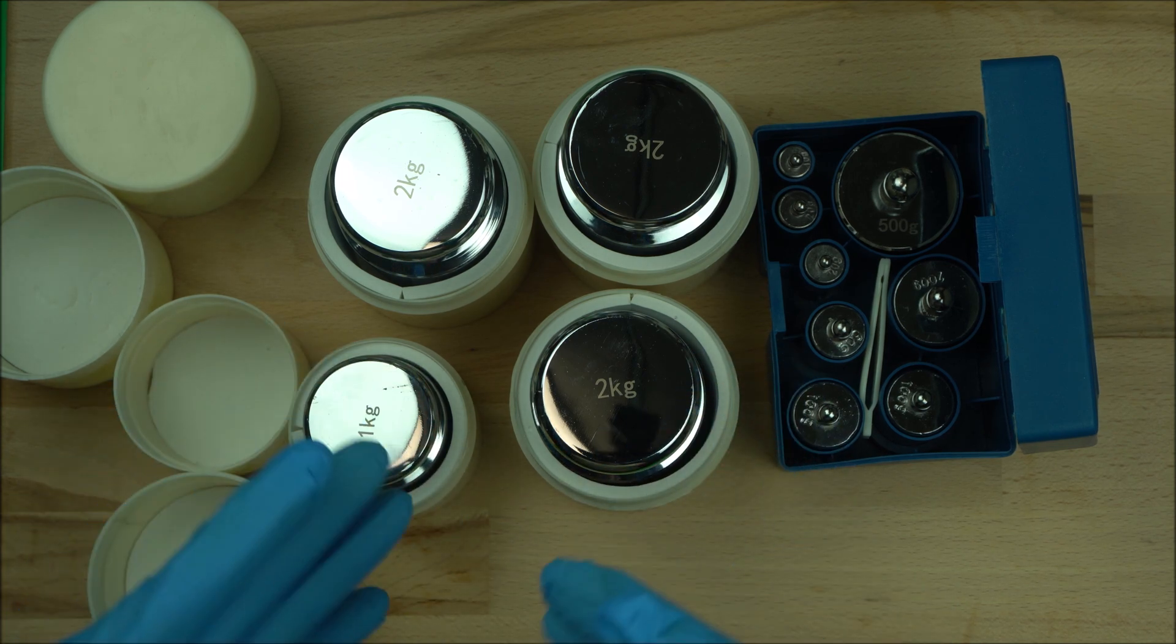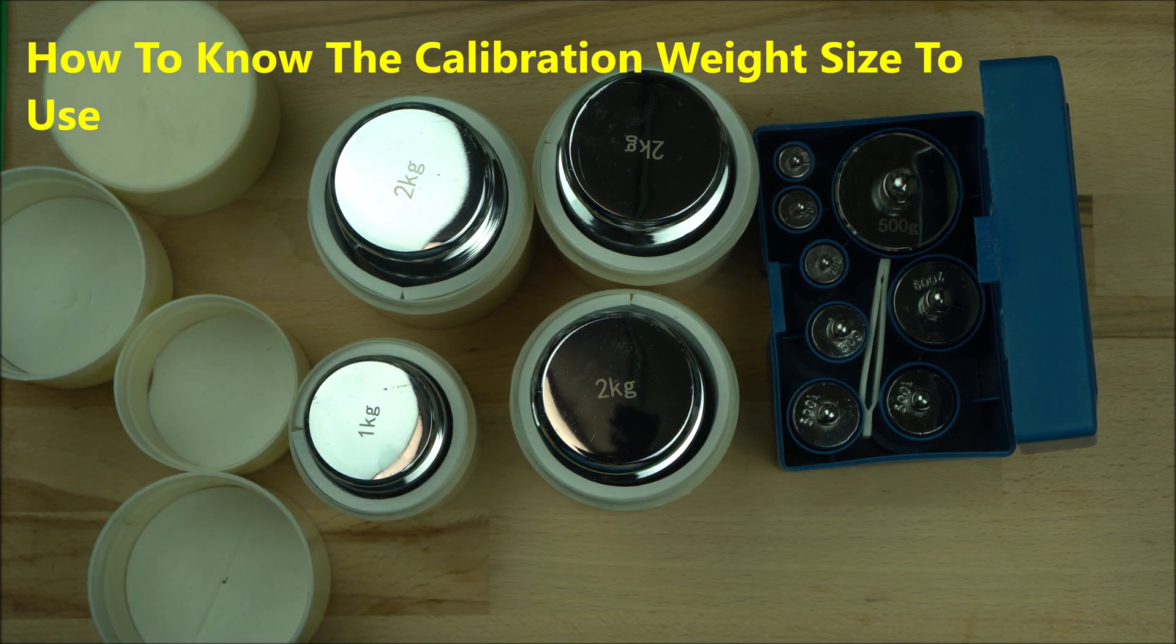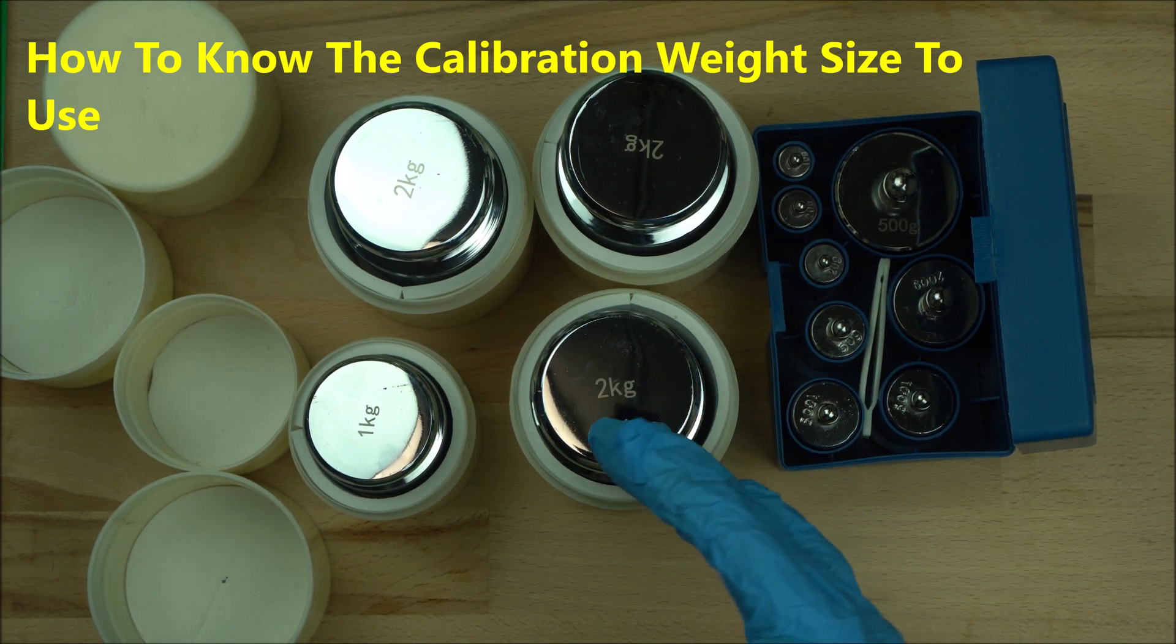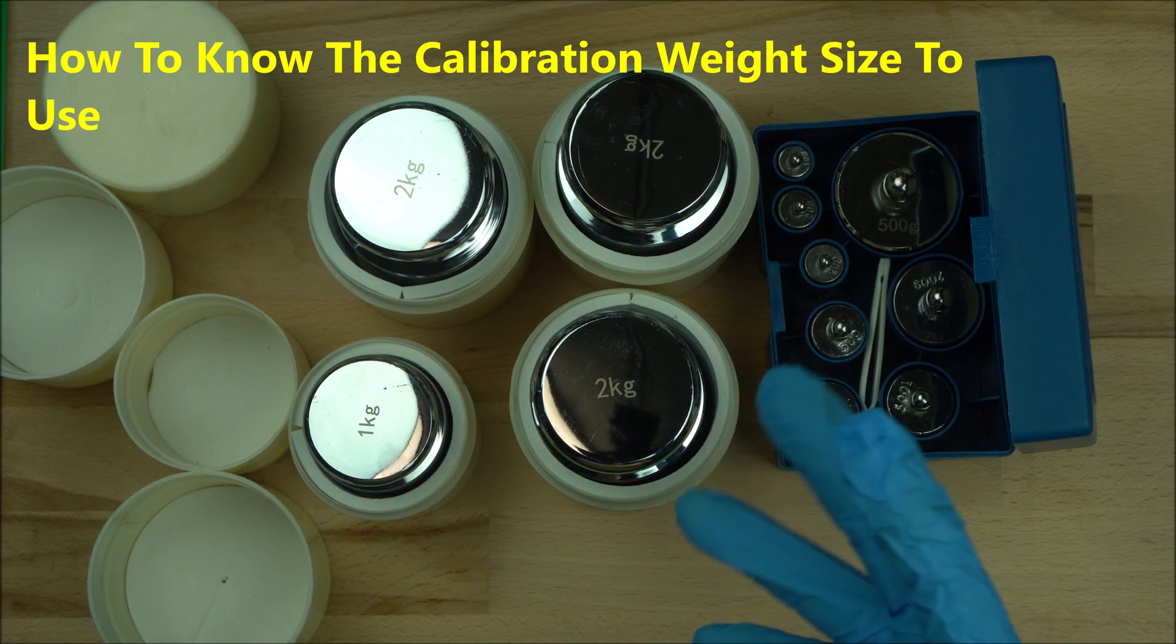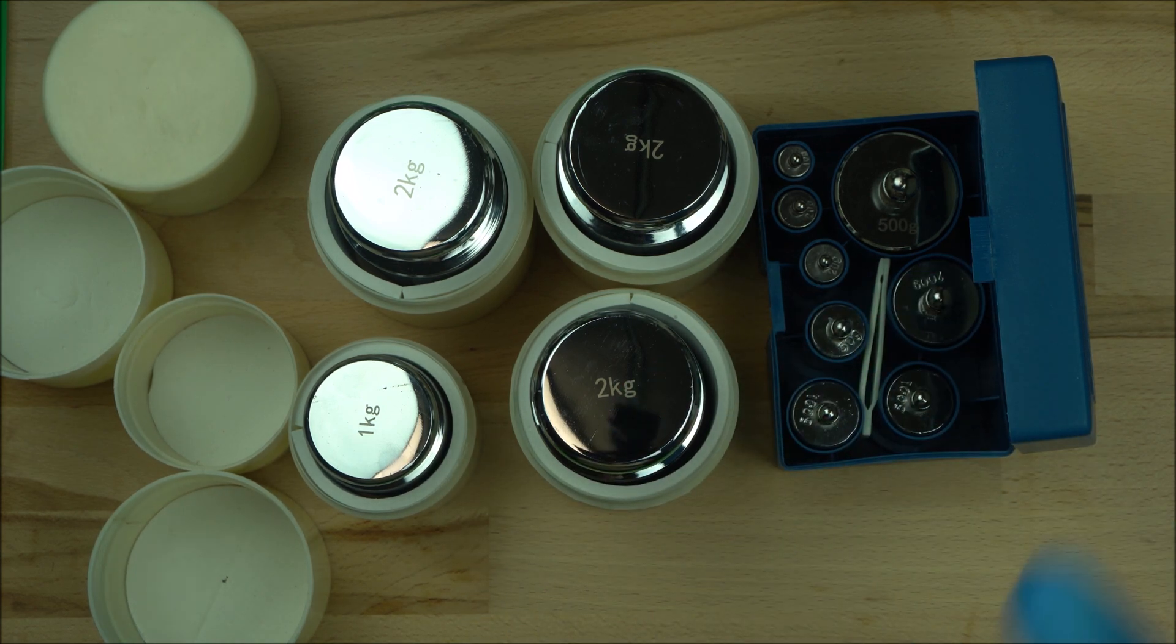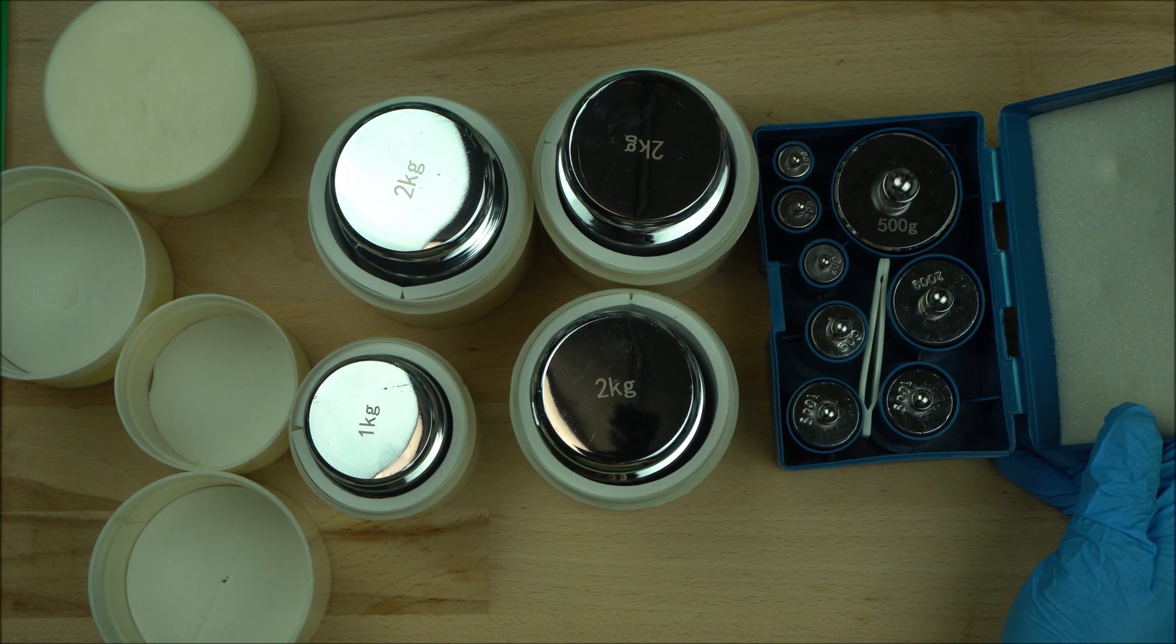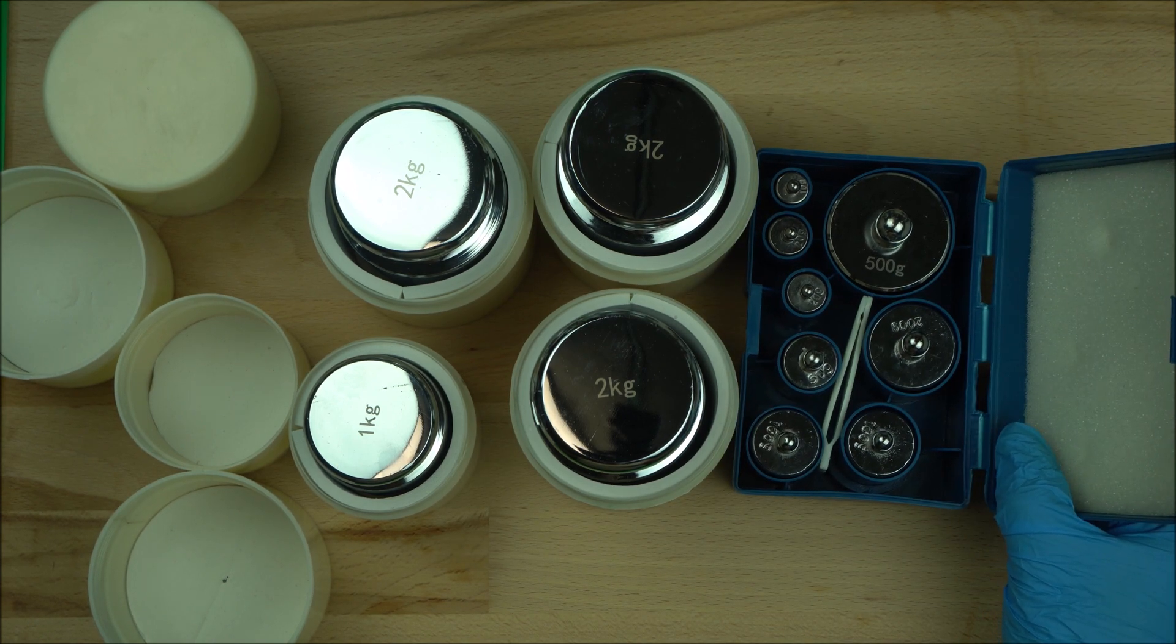Depending on the scale you use, your manufacturer should tell you the amount of weight to use to calibrate your scale. So if you do not know the weight to use to calibrate your scale, make sure you ask your supplier or distributor, whoever sold that to you.